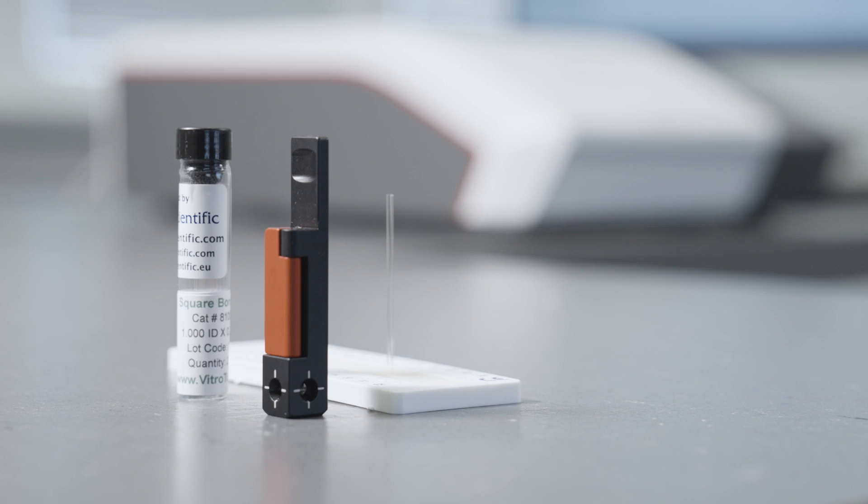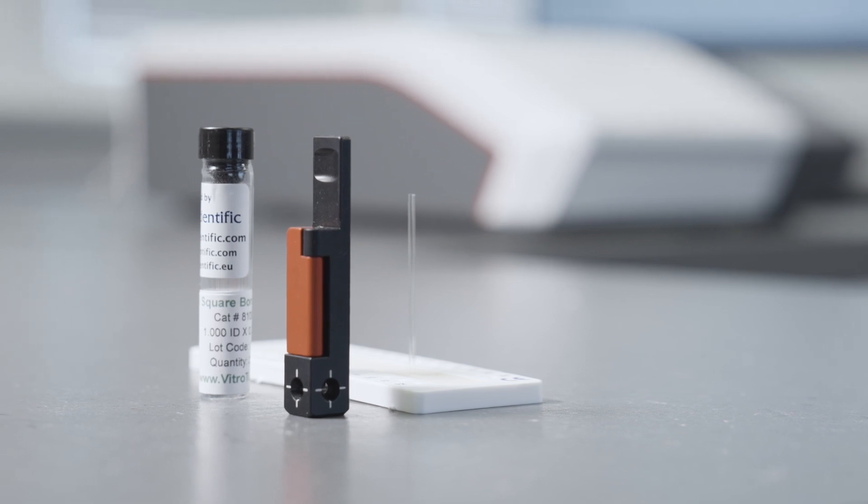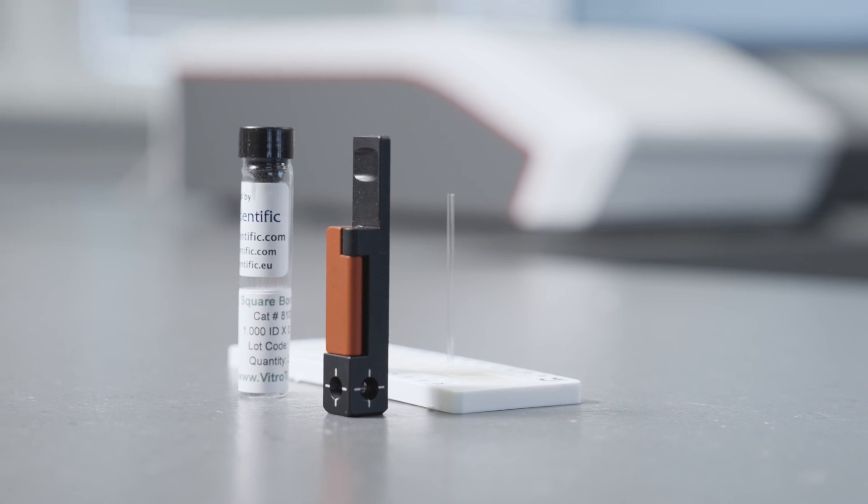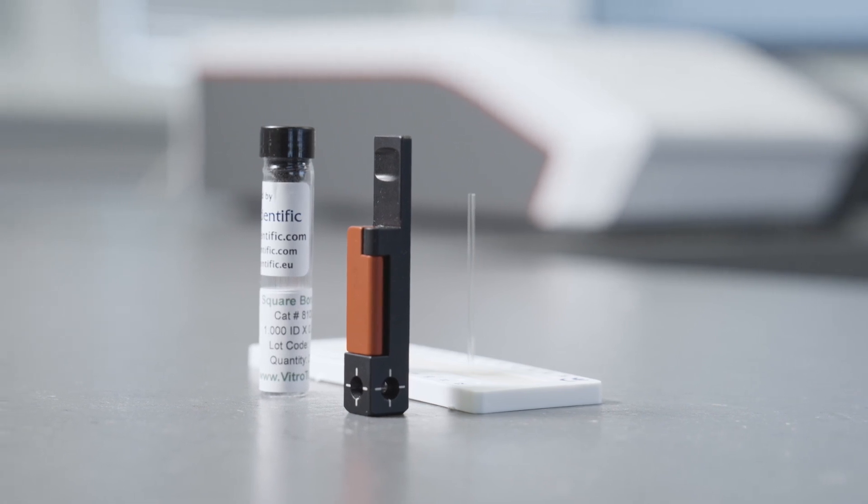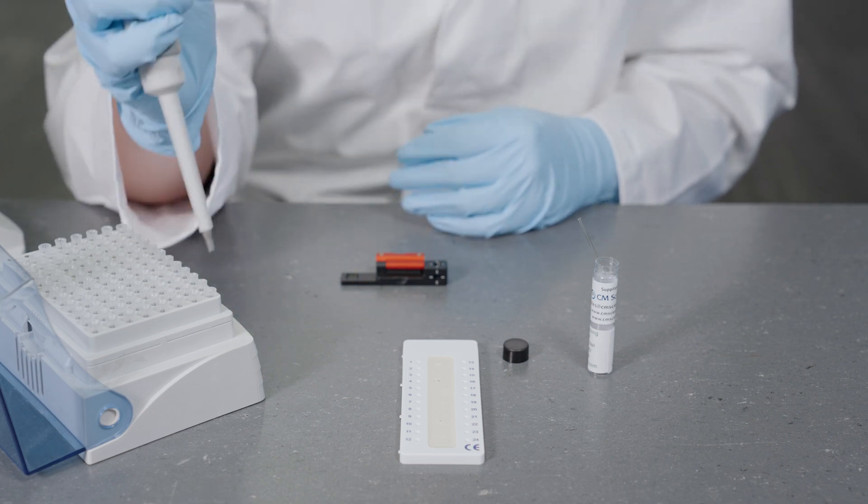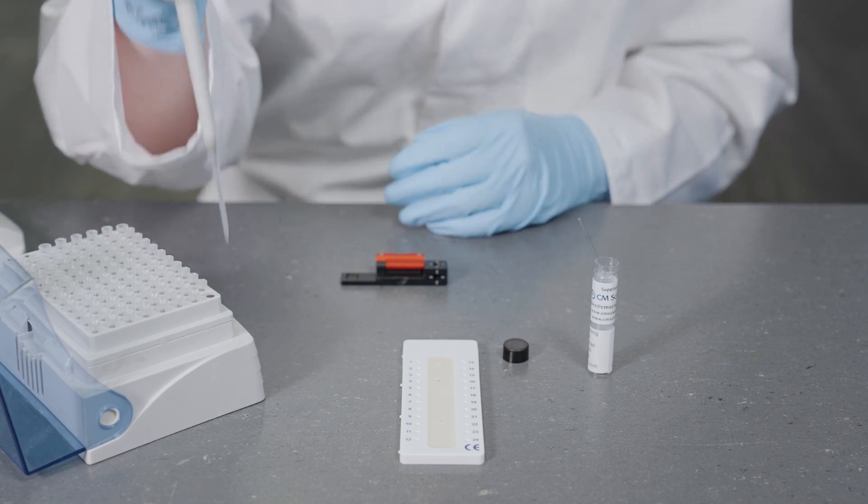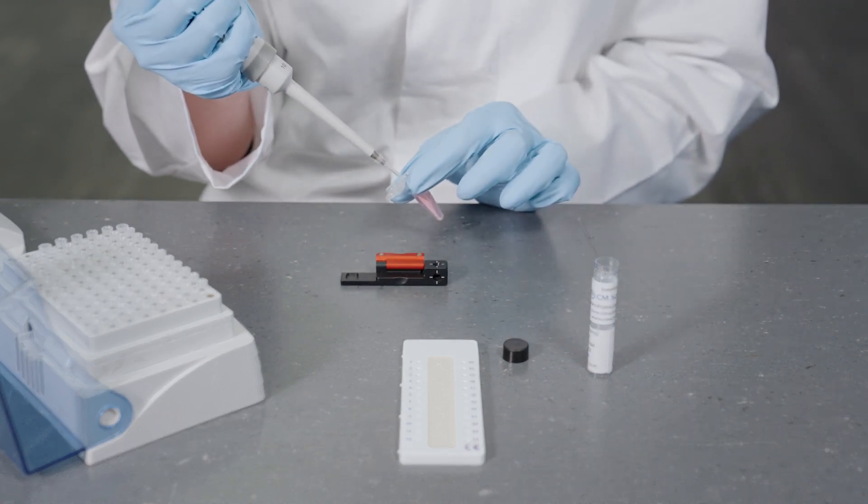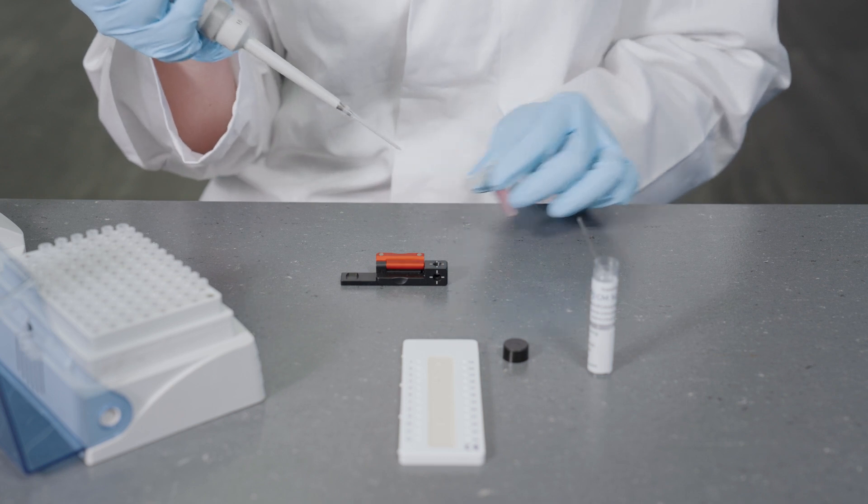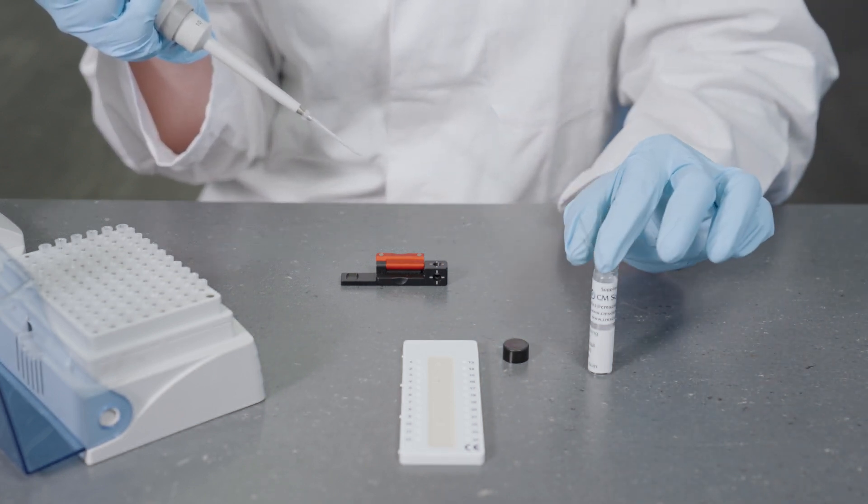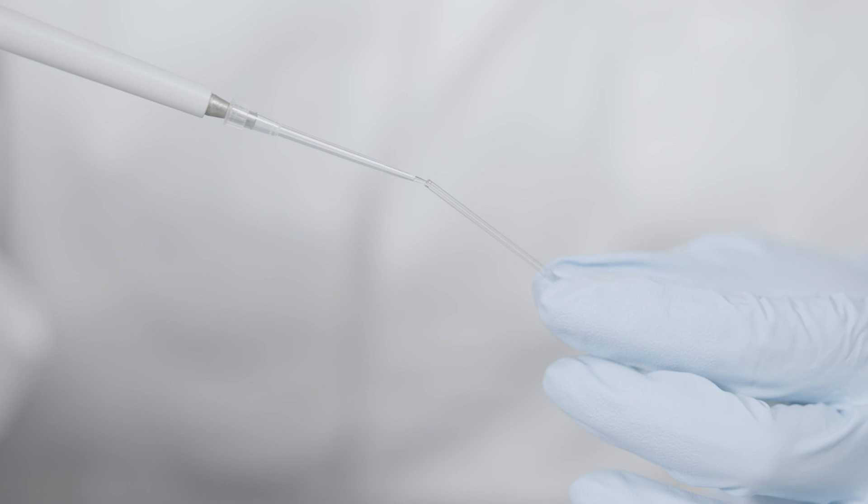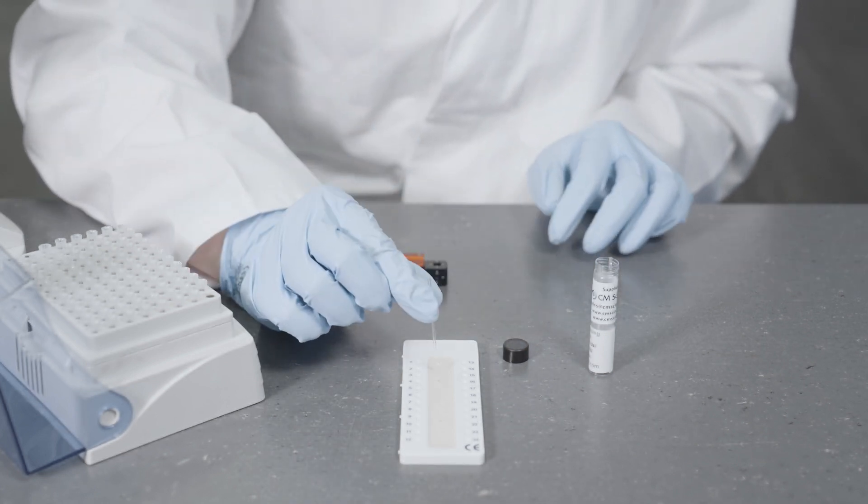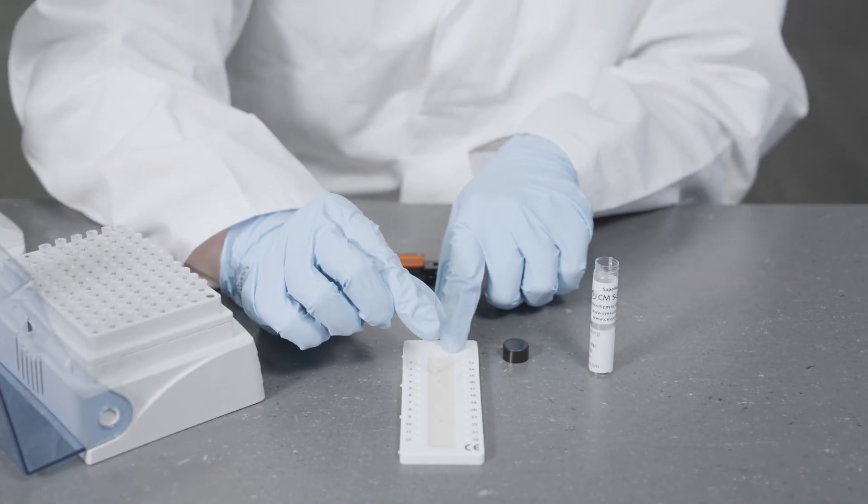This next particle size measurement is performed with the new capillary cuvette, which allows for a minimum sample volume of only 1.5 microliters. Fill the capillary with a micropipette. As with all our cuvettes, maintaining cleanliness is crucial—always wear gloves when handling samples and cuvettes. To avoid air bubbles, lower the micropipette plunger only to the first stop. Seal the capillary with hematocrit sealing compound.